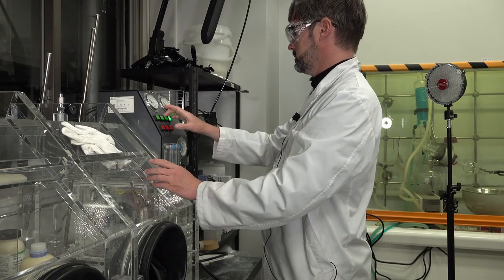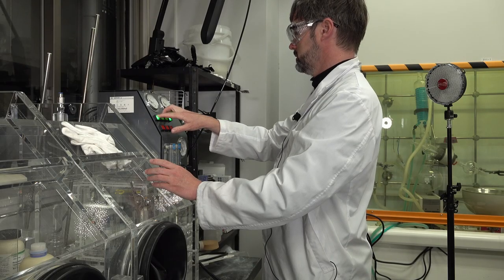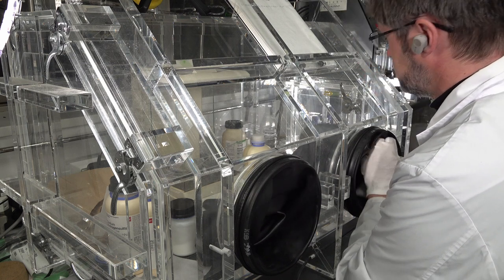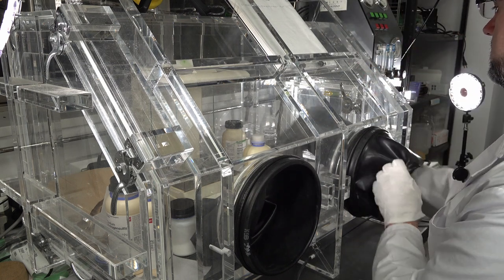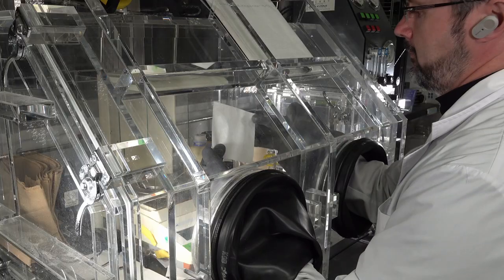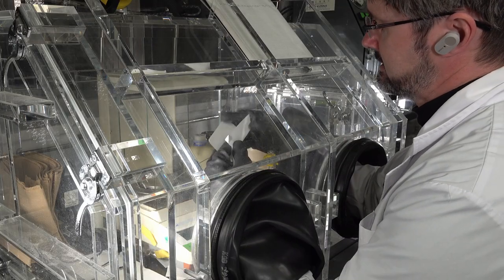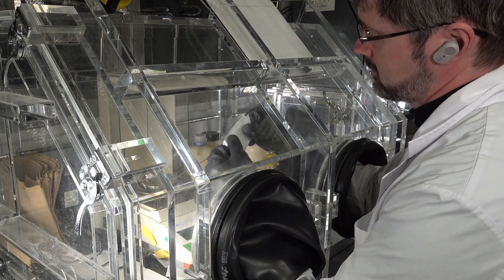I'm going to get my fingers now. Gloves. Folding these filter papers, it's always very hard when you've got glove box gloves on.